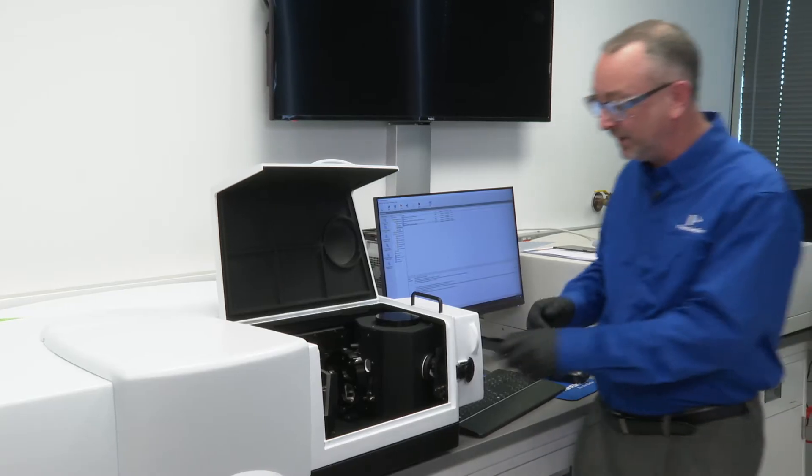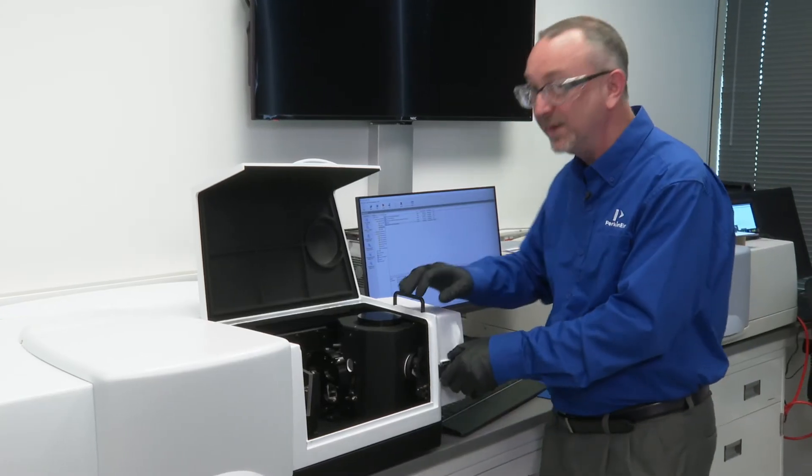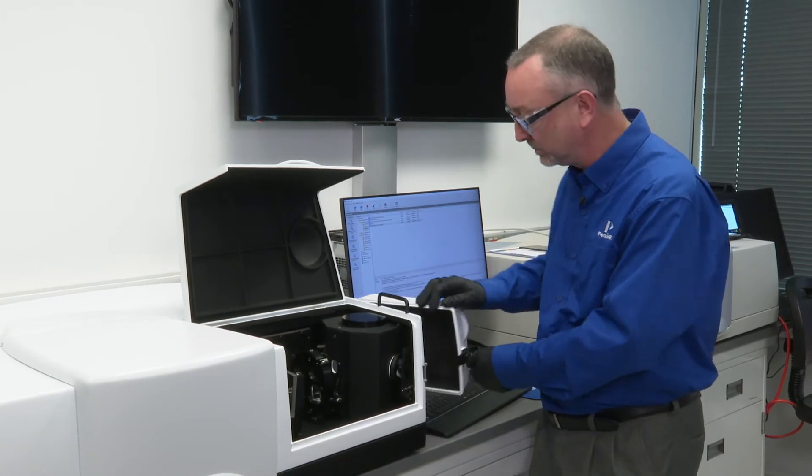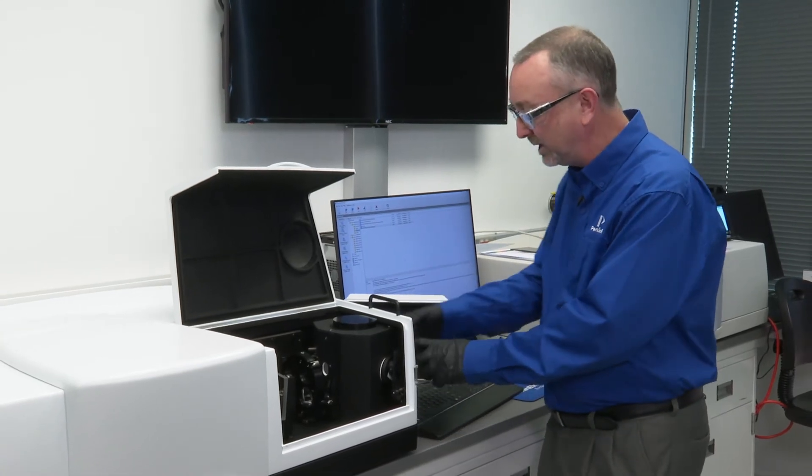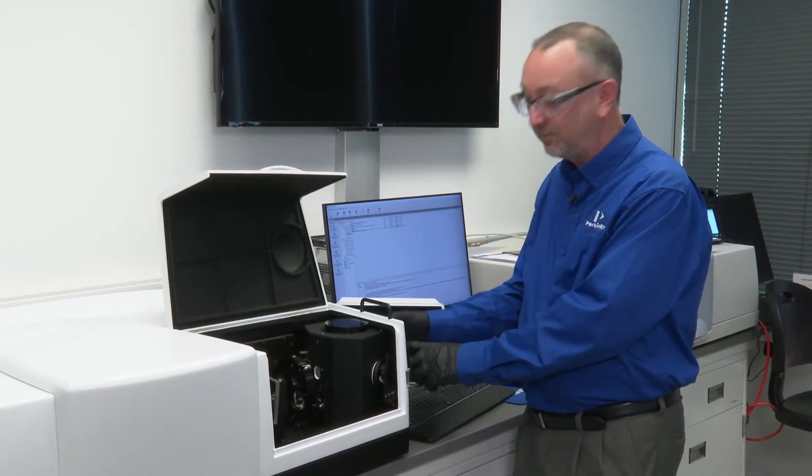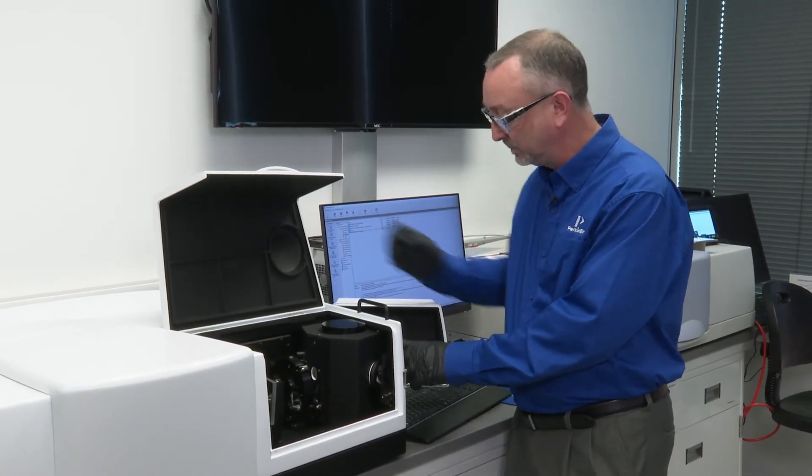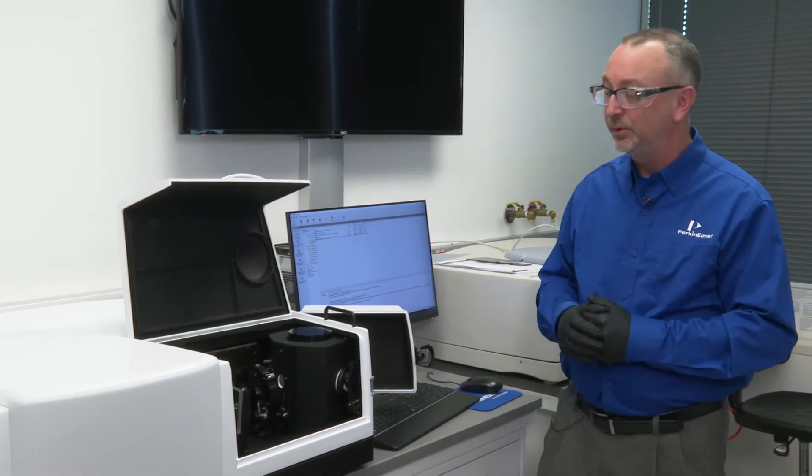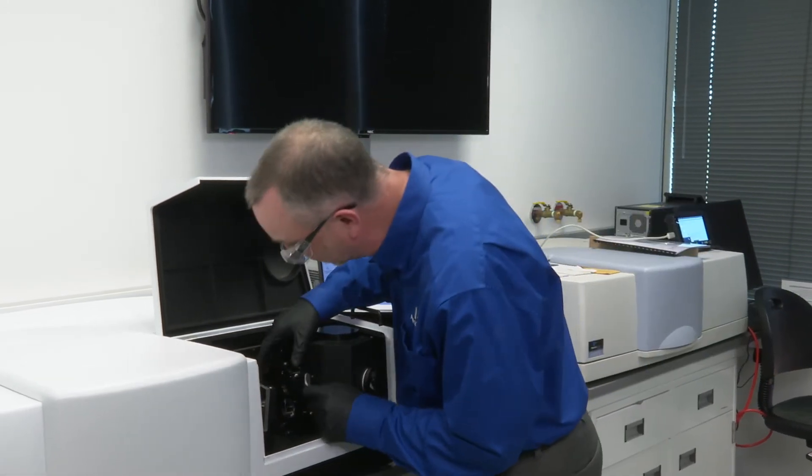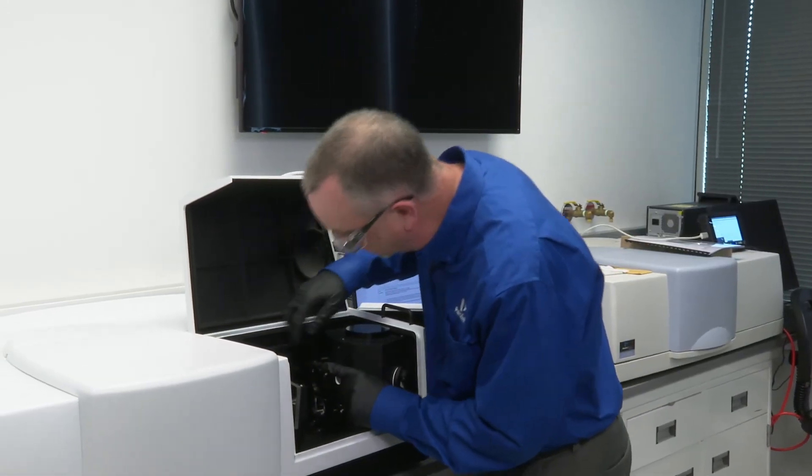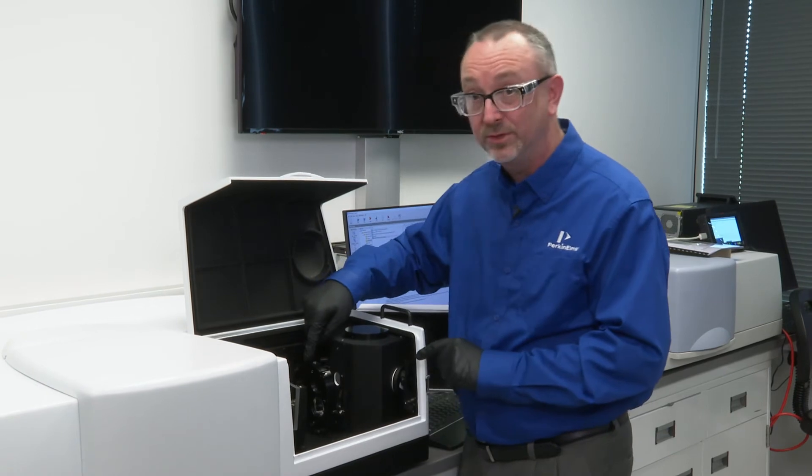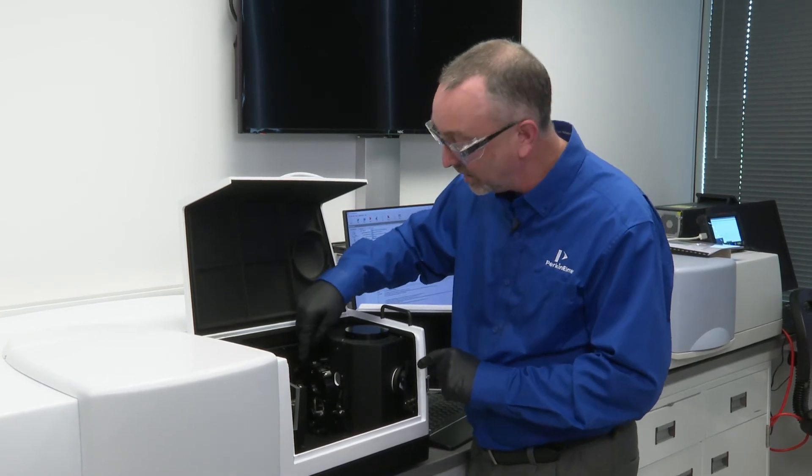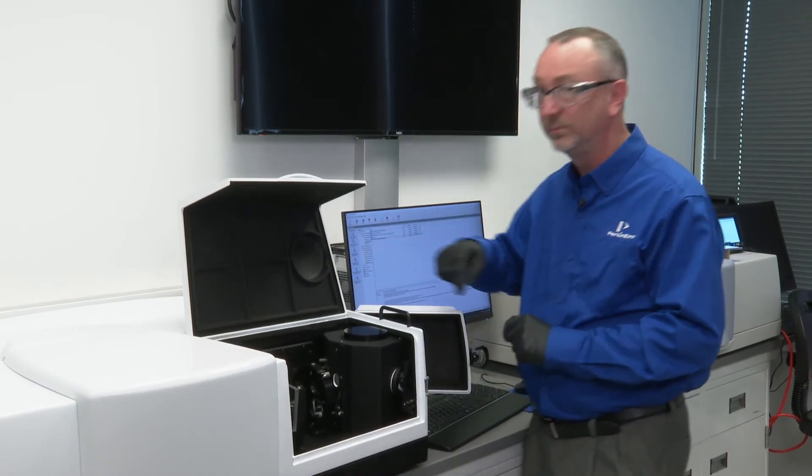Finally, if my sample was very small and I wanted to perform a reflectance measurement, I could then use what's called an aperture kit and in conjunction with that, rotate the lens, which is currently not there, to the R position.